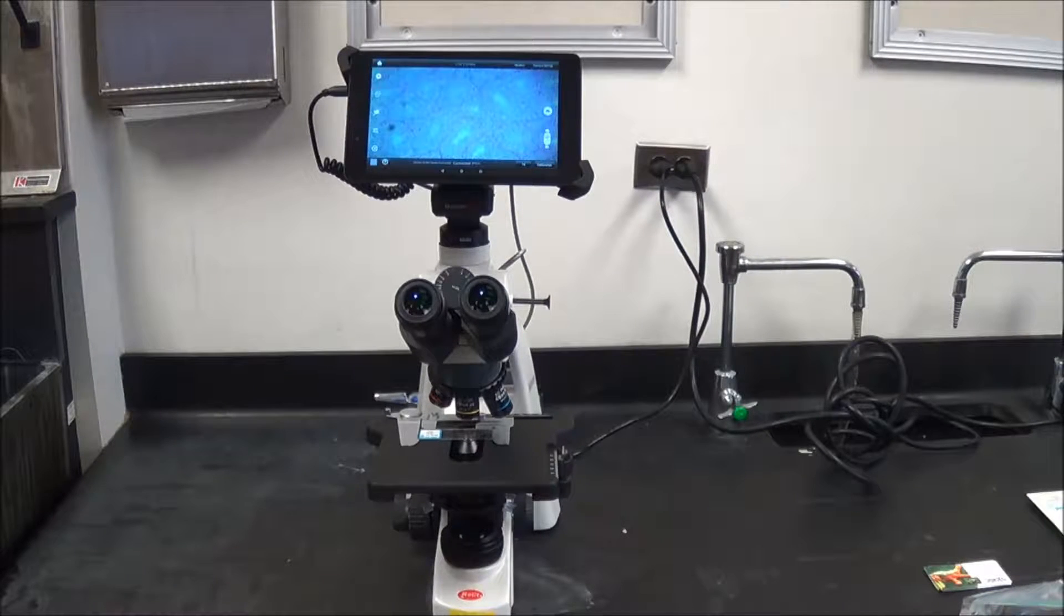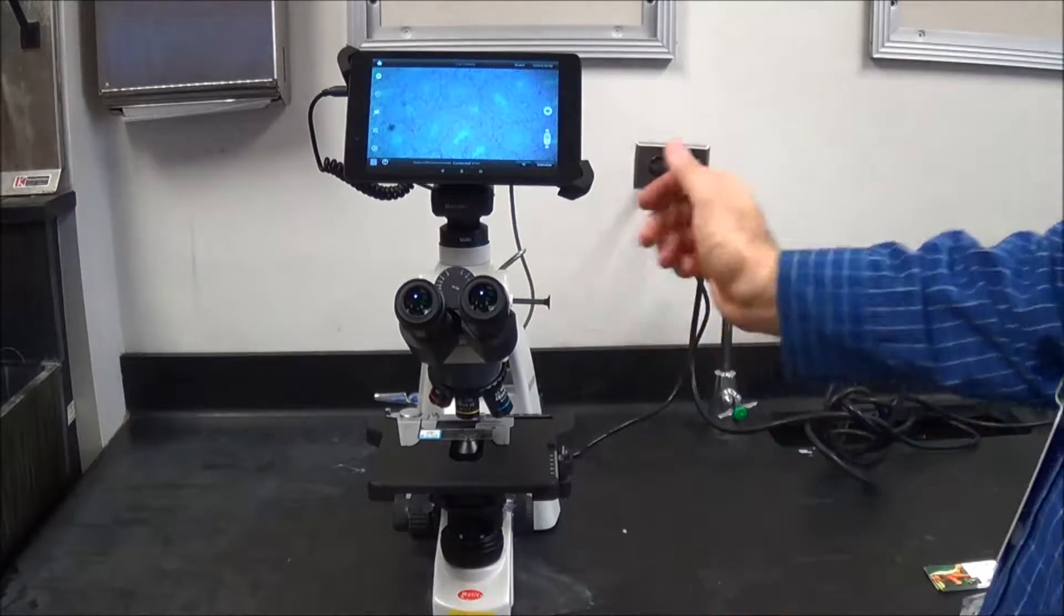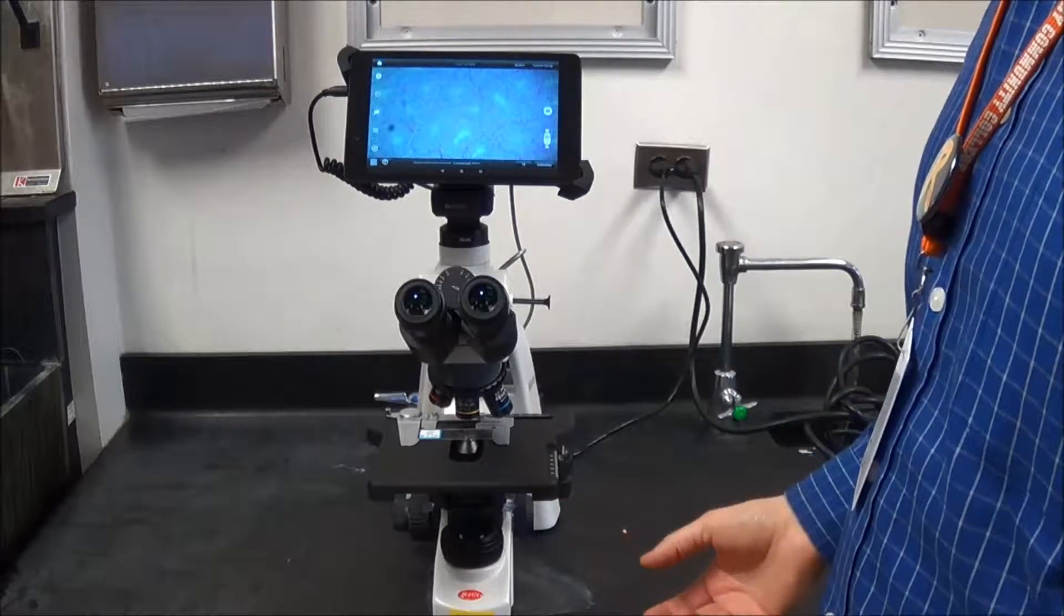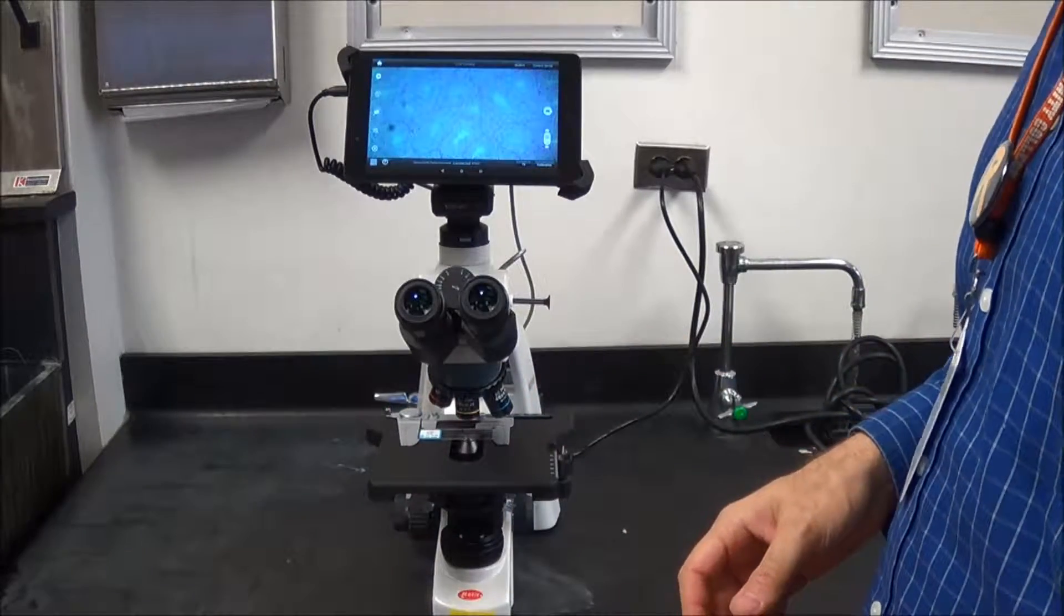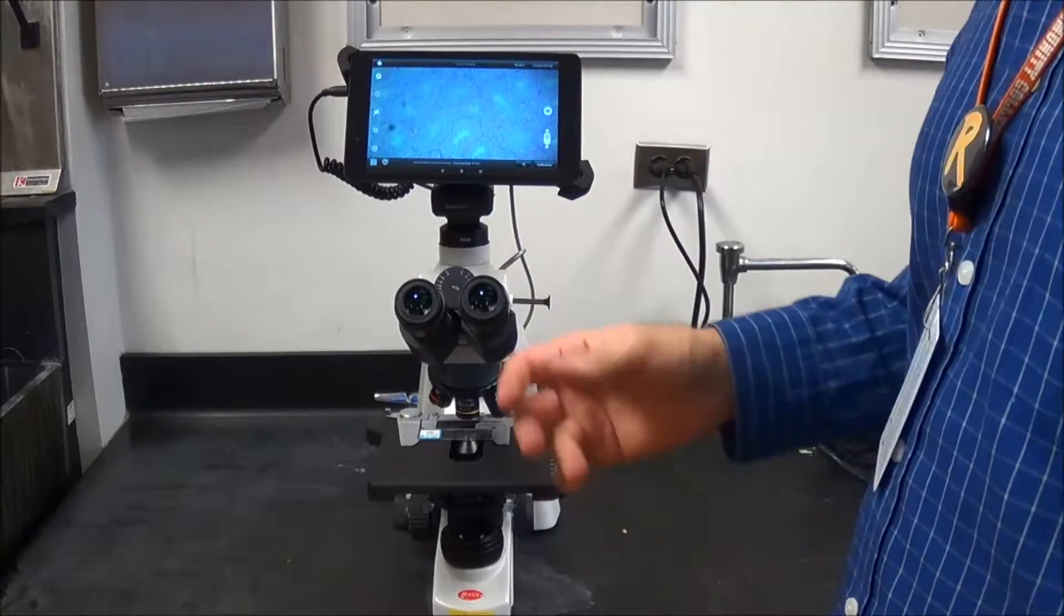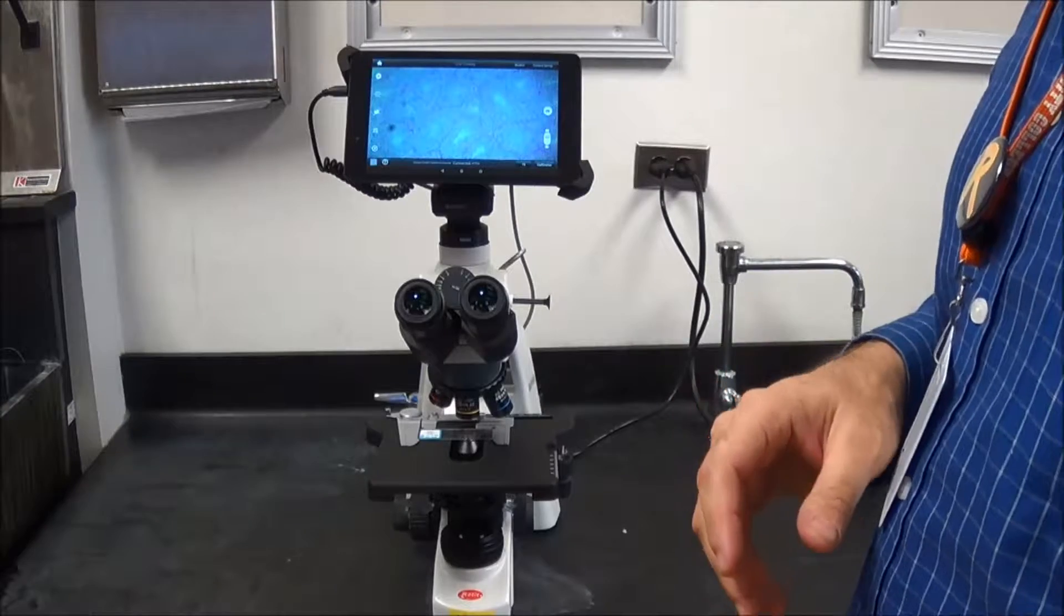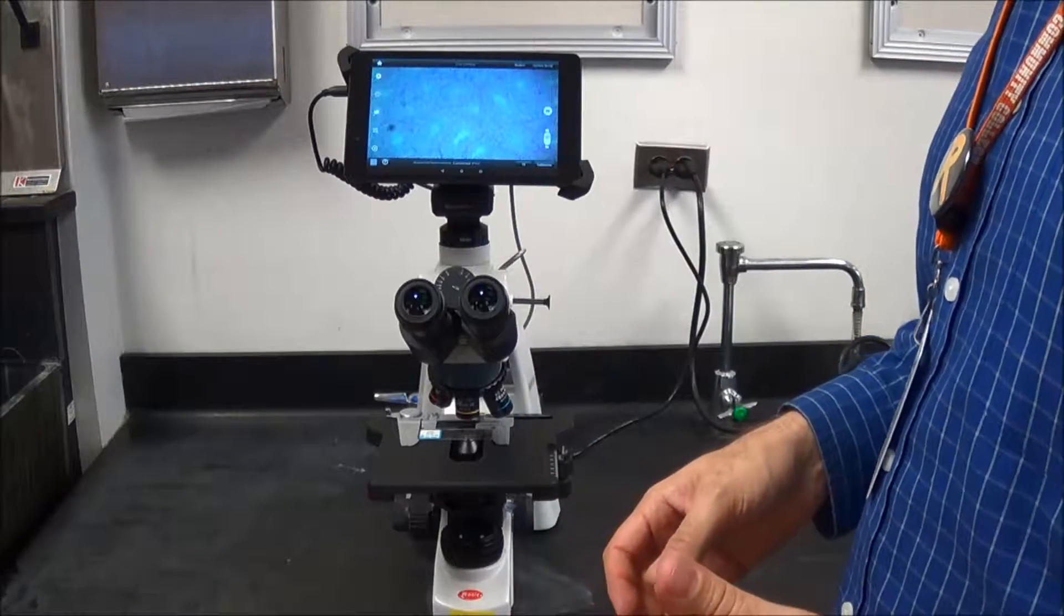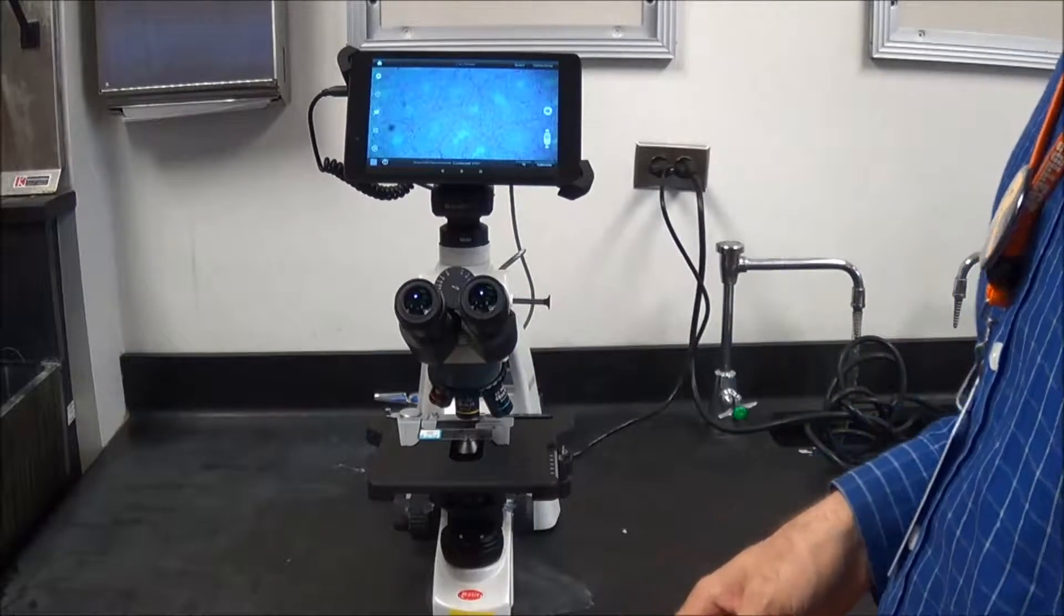Now that I've gone through all the aspects of how the microscope works, how to use the tablet, how to use the instructor microscope, how to use the software that goes back and forth between the microscopes and the instructor computer, we come to the last part, which is how to put away the microscope. We want to make sure that these microscopes stay in good condition and are ready and waiting for the next class to come in and benefit from them.